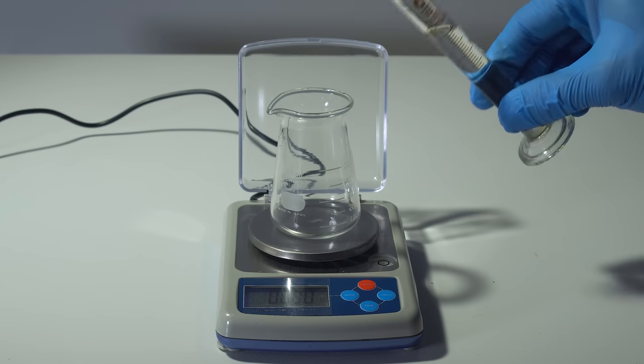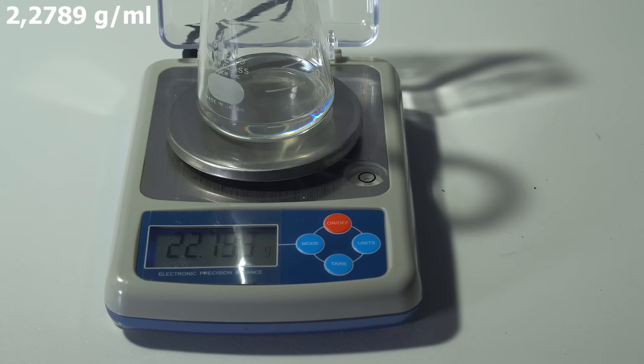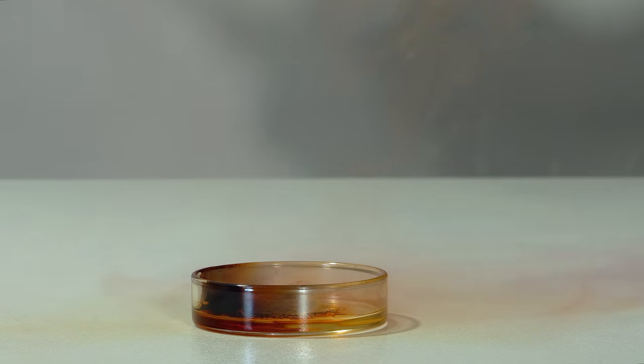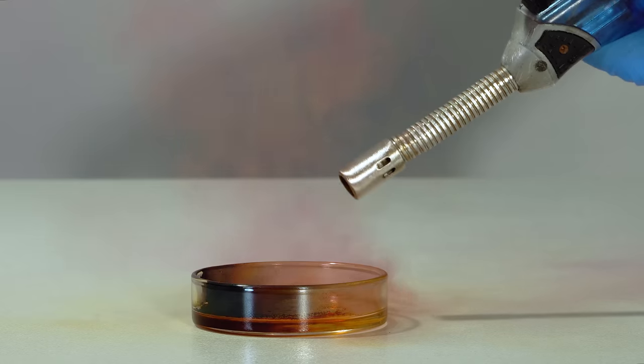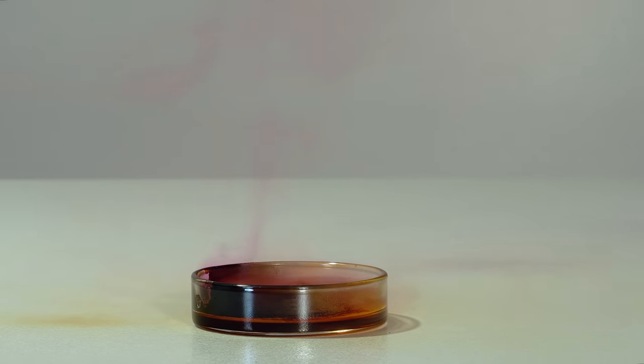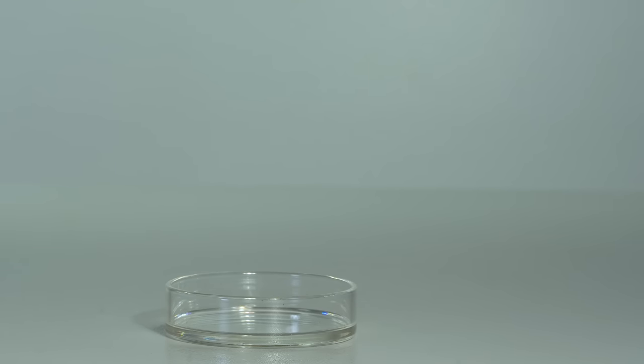For the first reaction I used methyl iodide, which is a colorless liquid with a density of 2.3 grams per milliliter. Methyl iodide is hardly combustible due to iodine vapors that kill the flame instantly. However, methyl iodide burns well when mixed with liquid oxygen.